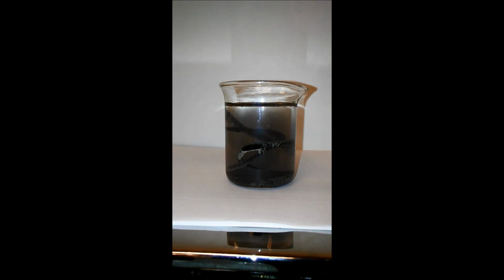Iron solutions, depending on whether you have iron 2 or 3, and we could actually use the color that we get to figure out which one it is, tend to be a yellowish or orangish solution, though one of them is more vibrantly colored than the other. The downside is silver nitrate, when exposed to light, discolors, and so that's why it's as dark as it is.